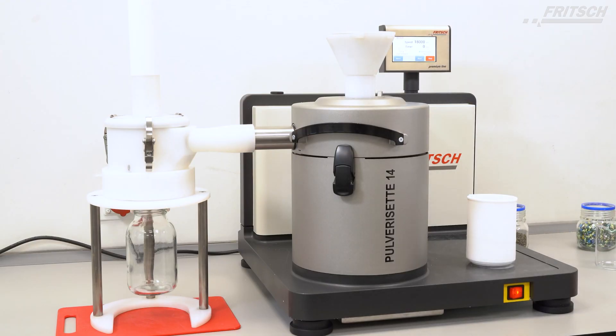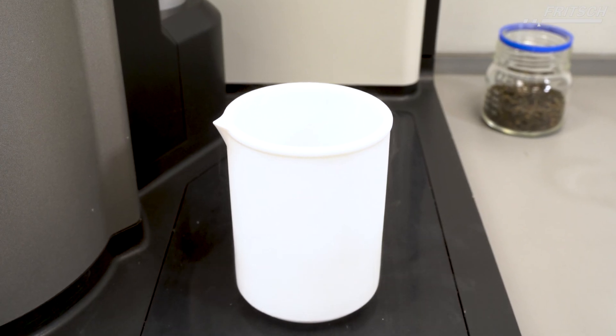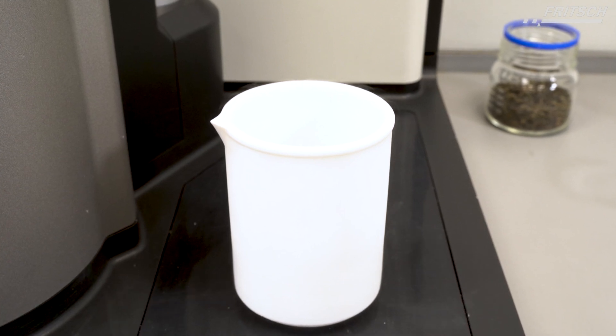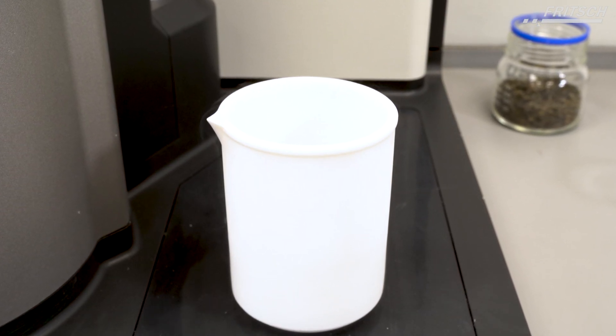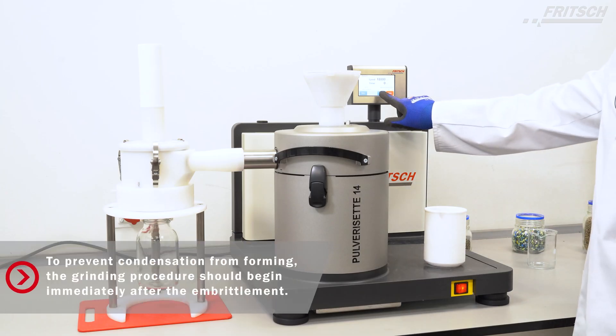If necessary make sure you wear safety gloves and also glasses. Working with liquid nitrogen might be dangerous. Now we can start the grinding.